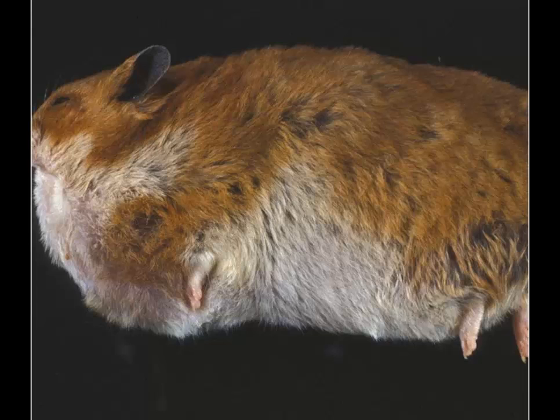Our last slide for today is a hamster. It's an old hamster. I'd like 2 morphologic diagnoses. Okay, first morphologic diagnosis is anasarca. This animal is severely hypoproteinemic. And then the second, or the likely associated lesion, I should have phrased that better, my apologies.